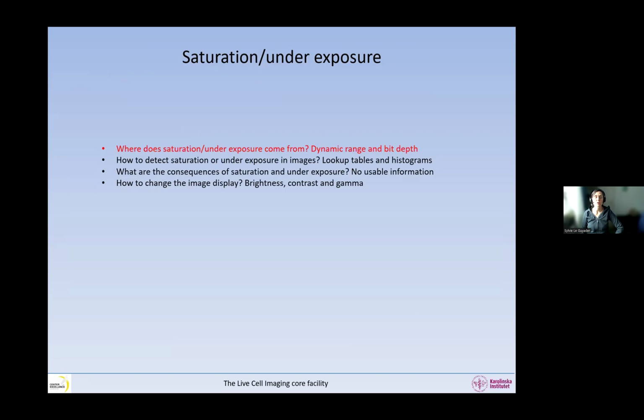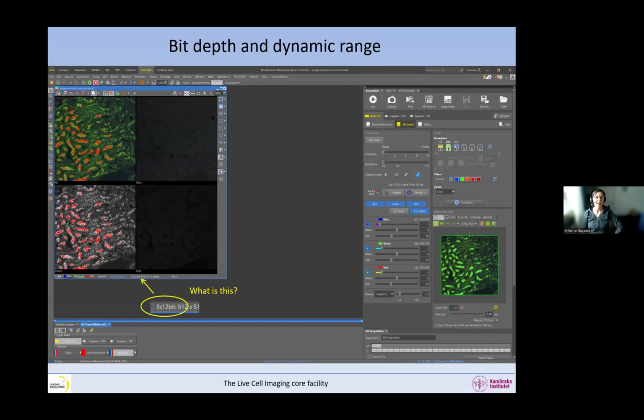So let's talk about the first one. Where does saturation come from? The bit range, the dynamic range, and the bit depth. If we have a look at the image, in the Nikon software the bit depth is at the bottom of the image, but in the Zeiss software it's somewhere else, and you have to figure out where in the software the bit depth is written. It's definitely written somewhere, and you will have to find out in one of the portfolio assignments. So, this is the bit depth. It says 3 times 12 bits, and it's 3 because we have 3 images. So each image has 12 bits.